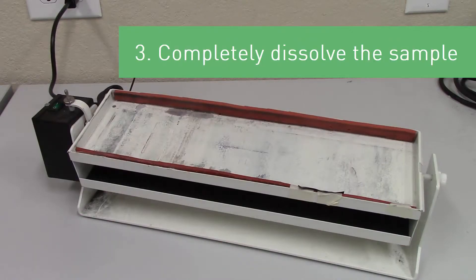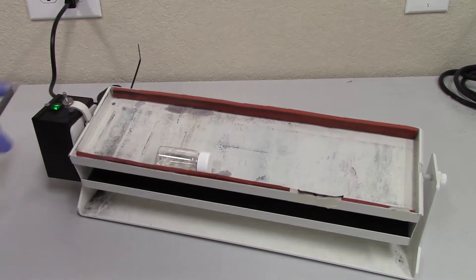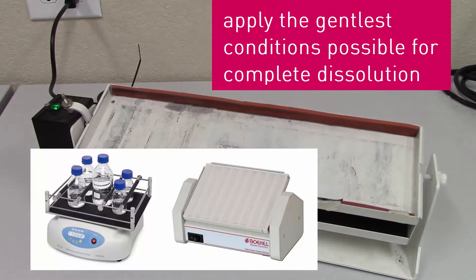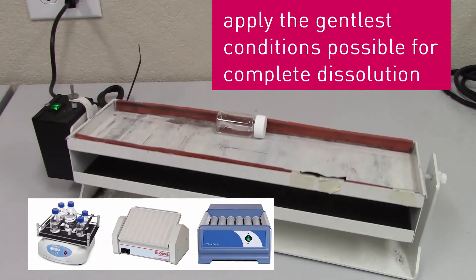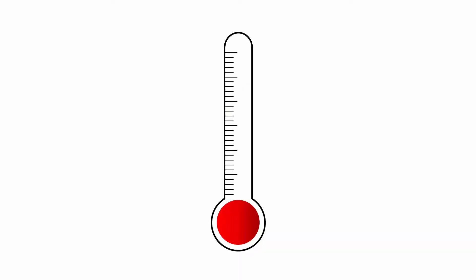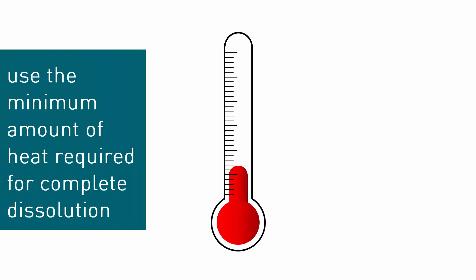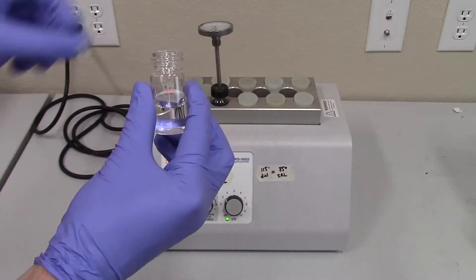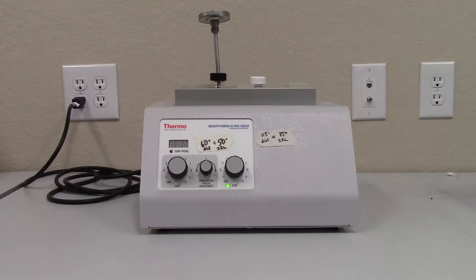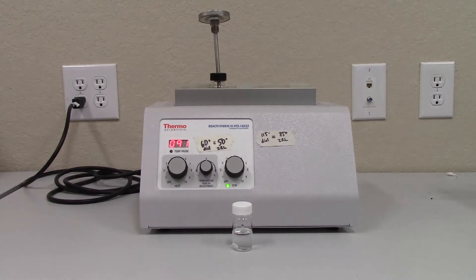Third, apply the gentlest conditions possible to facilitate complete dissolution of the sample. This can be done by simply letting the sample solution sit on the bench at ambient temperature or applying gentle agitation with a shaker, rocker, or rotator. A stir bar or vortex are not ideal options but can be used if the sample is stable enough to maintain its integrity throughout the process. Temperature is another way to encourage dissolution. If heat is applied to a sample, it is recommended to use the minimum temperature and time required and to combine it with gentle agitation in an effort to minimize any potential sample change or degradation. It is also important to check that the sample will remain in solution when cooled down to either ambient temperature or the temperature of the autosampler, columns, and detectors.